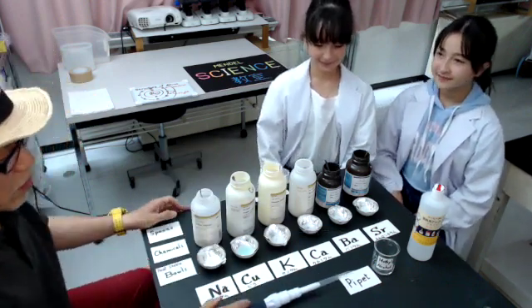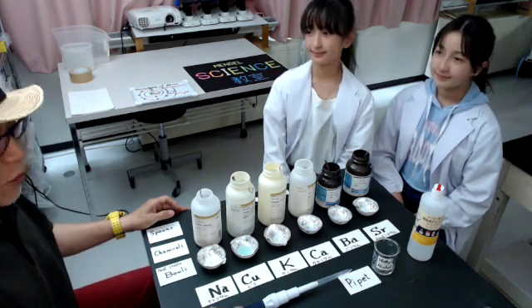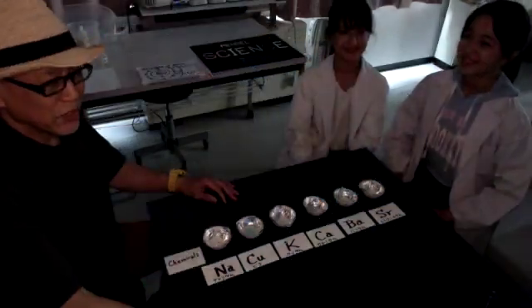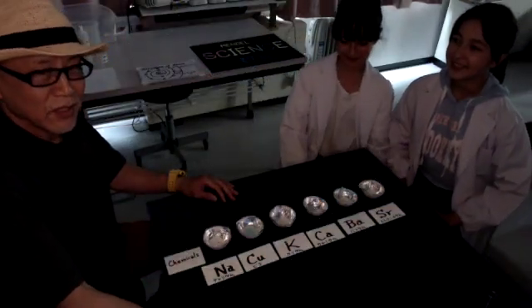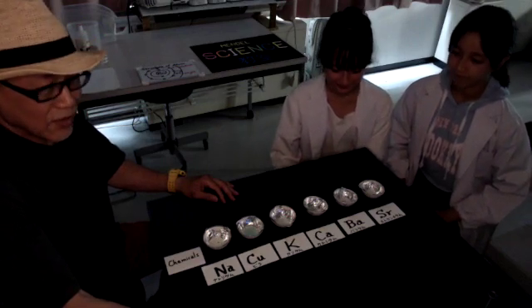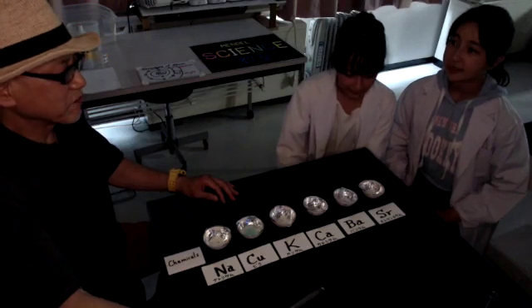The entire preparation of the chemicals for this experiment has been finished. Now we are ready for observation of the flame reaction of each element. Let's start from strontium, one by one.